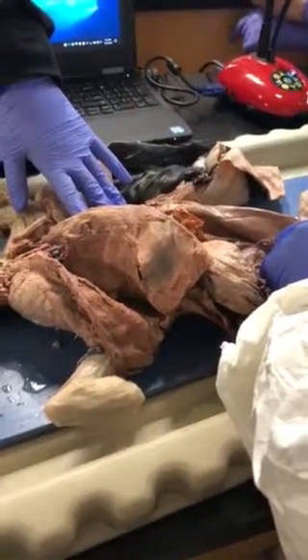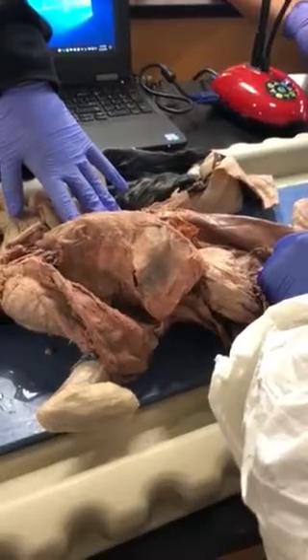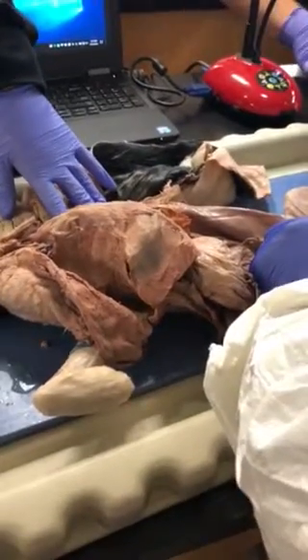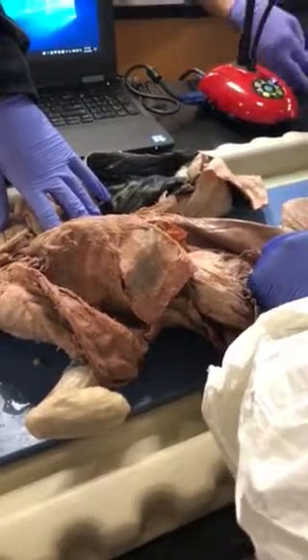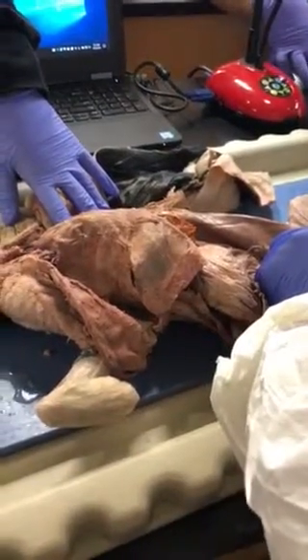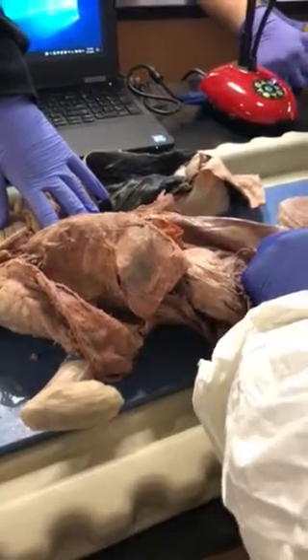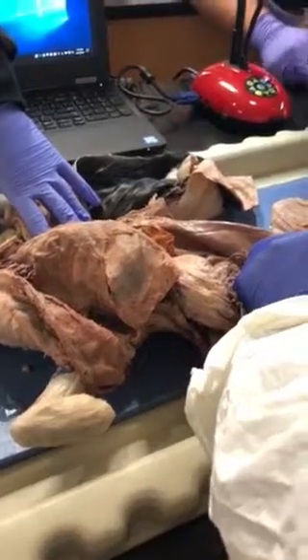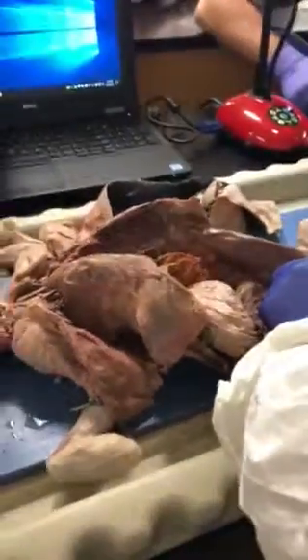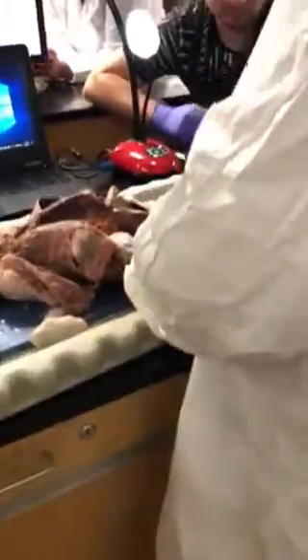Going to the pulmonary trunk in the heart — you cannot confuse it because the pulmonary trunk crosses the thoracic part of the cat. The opening, or flap, in the pulmonary trunk is called the pulmonary semilunar valve, and then you have the aorta. The flap found in the aorta is called the aortic semilunar valve.